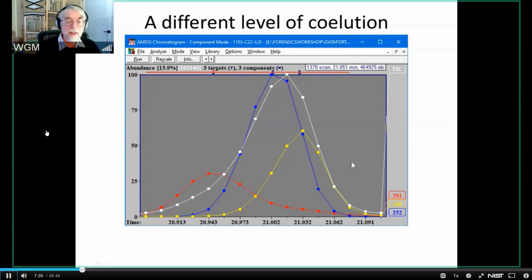It looks at the shapes of these things and pulls them out, not based on the spectra in a library, but based on the shapes. And I noticed one of the questions that came up in the discussion of Ed's talk was whether or not you needed a library to do the deconvolution. And the answer is no. You can find all of the components in the data file without having a library at all. You don't identify them. You have to do something else. But what you get out of it are pure spectra. And those pure spectra can then be sent to the NIST library, or they can be handled within AMDIS itself if you have a target library built into AMDIS. And I'll discuss that just briefly later.